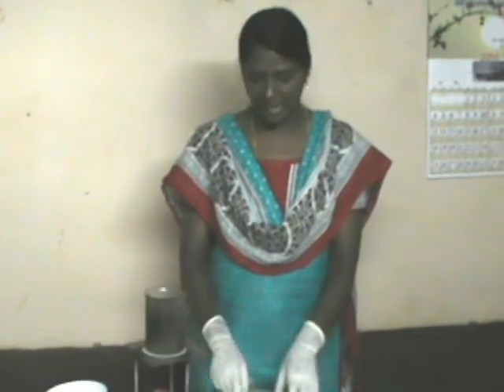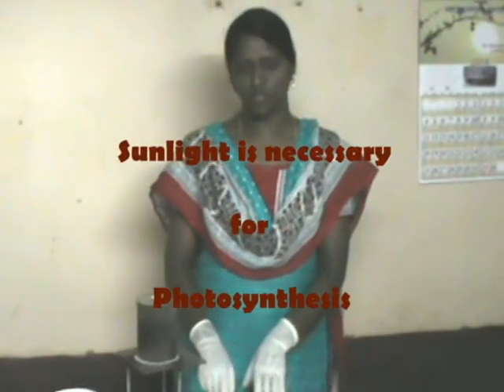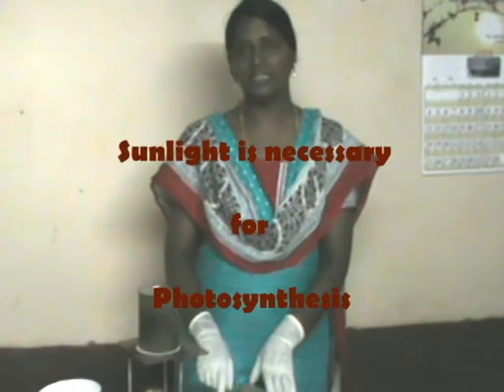We observe that the area which received sunlight turns blue with iodine, and the area that did not receive sunlight is not blue in color. This confirms that sunlight is required for photosynthesis.